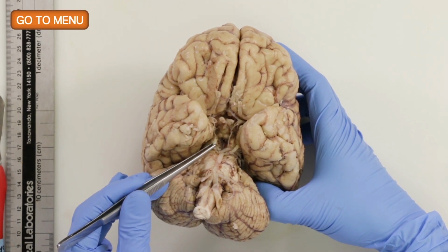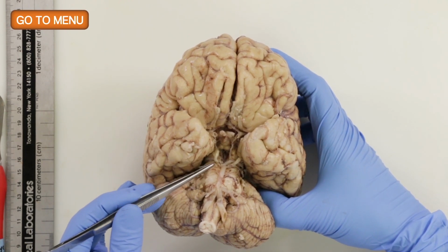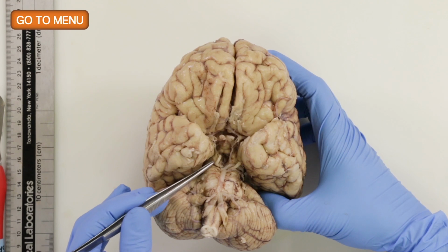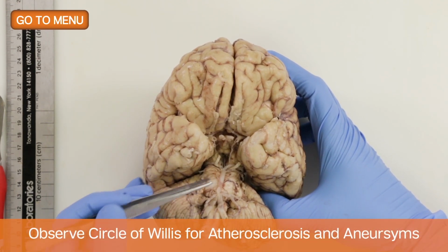That looks like the oculomotor nerve. That's right, so that's the third cranial nerve, which projects right through the superior cerebellar artery and the posterior cerebral artery, which it's doing, so it's in the right spot. This is the basilar artery.